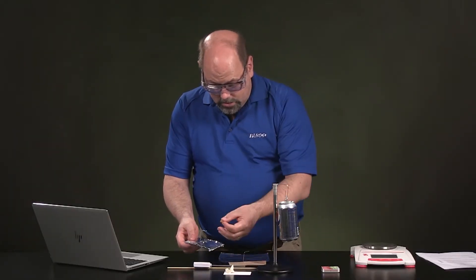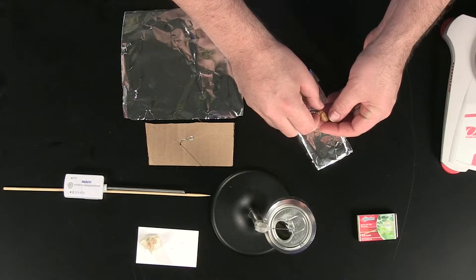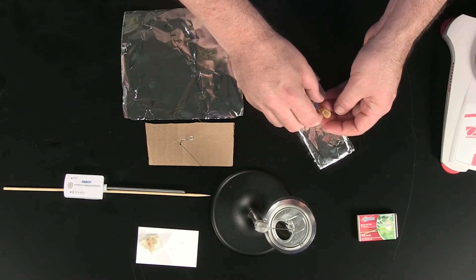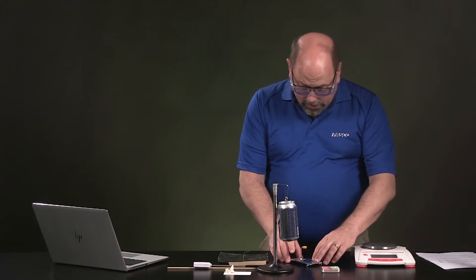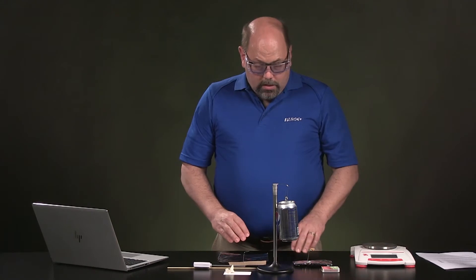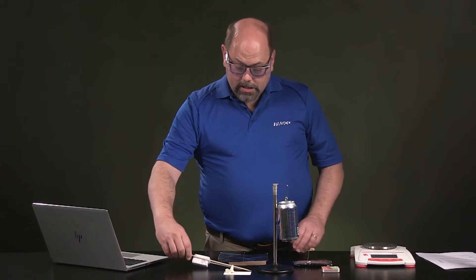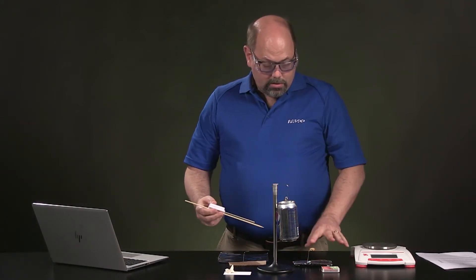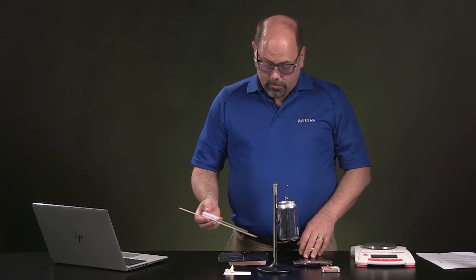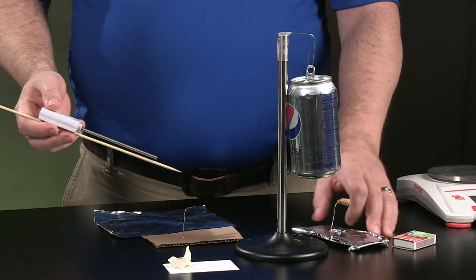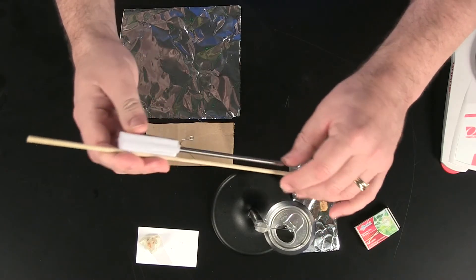And then you're going to use that little circle that you may have bent with like a pliers or with your fingers. We're going to put the material onto that. So that's the peanut. And from there, we're going to weigh that and get the weight of that material, which we'll get into in the data collection phase. But I'm going to say next, once you've got your either your material like the sugar or the peanut onto your holding device, you're going to put those underneath the can. And you're going to take the thermometer, place that into the can.